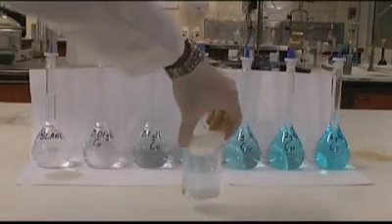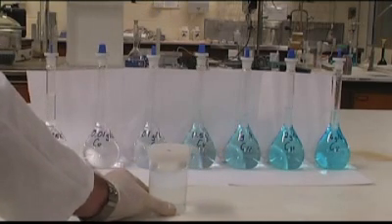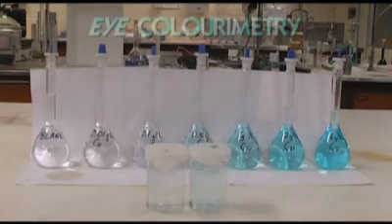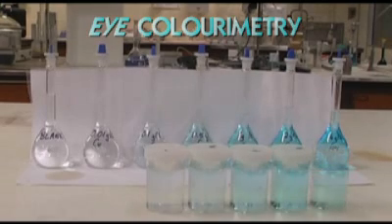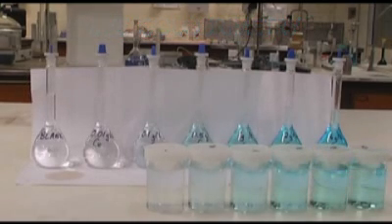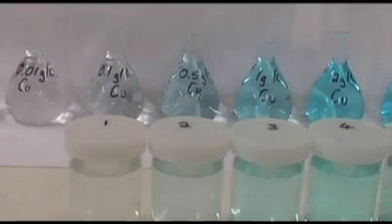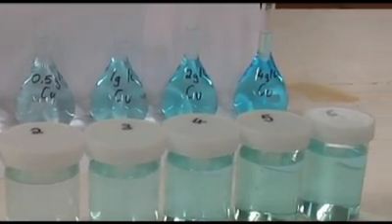So if my school didn't have one of those fancy gadgets, we could do what he's doing. Correct. We're using a technique called eye colourimetry. This is where you can compare the colour of copper sulphate solutions of a known concentration with the resultant solution that you have. By holding each sample up to the light alongside the standards, it's possible to make a good approximation of the copper ion concentration.